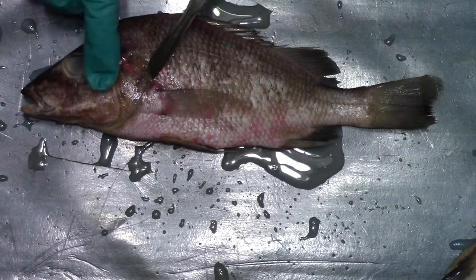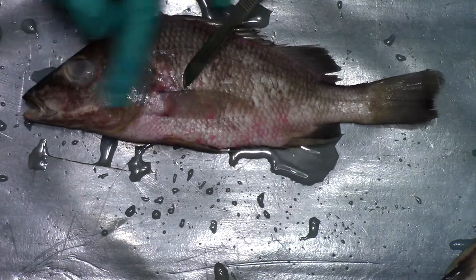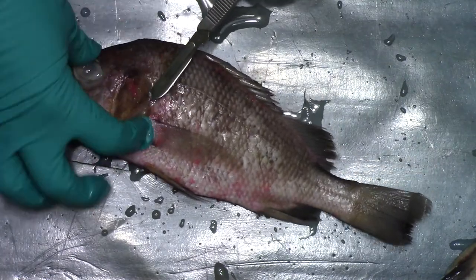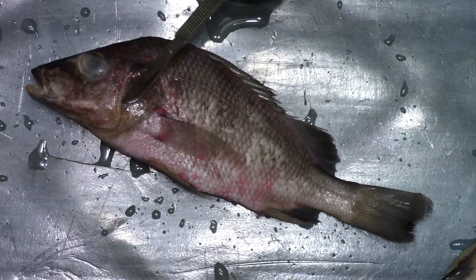Another cool thing about the teleost fishes that we didn't see in the sharks is this hard operculum covering the gills. It's like a bony plate that protects the gills from the external environment.